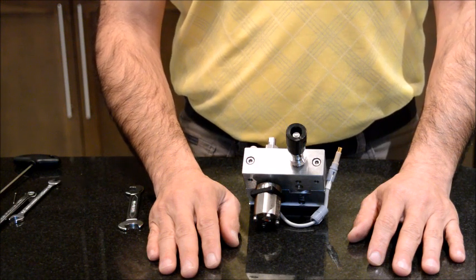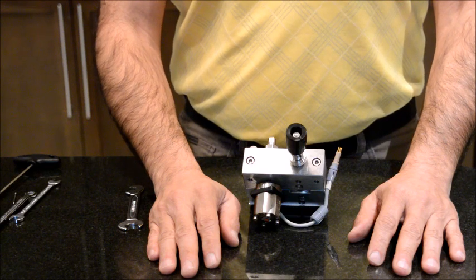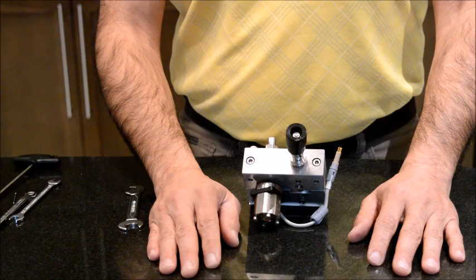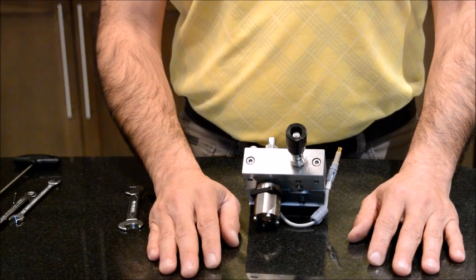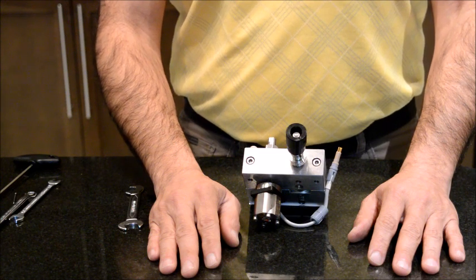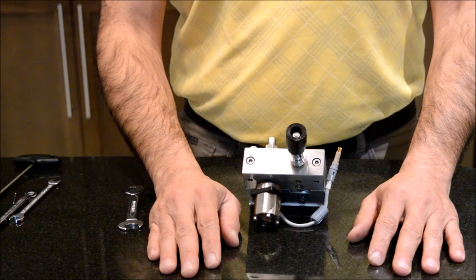It is meant for the analysts or chemists who are running HPLC, and they may face problems during the run and they don't know what causes them. And hopefully, by watching this video you will learn more about the pump head, and probably you'll start doing some good practices to prevent the pump head from breaking down.